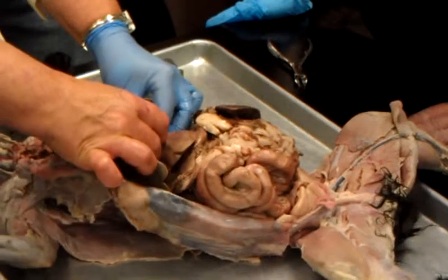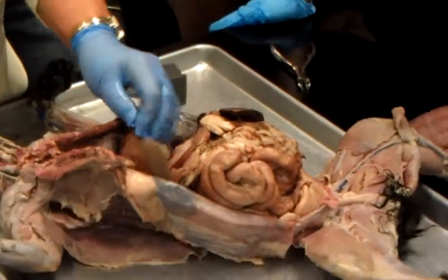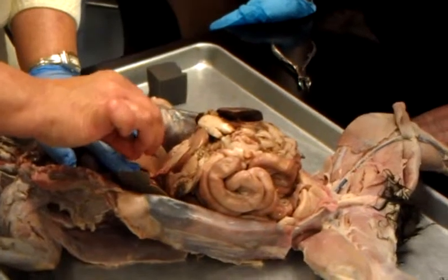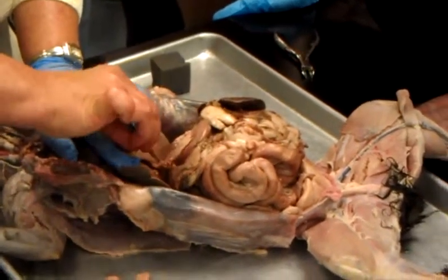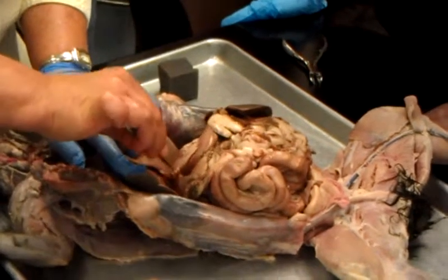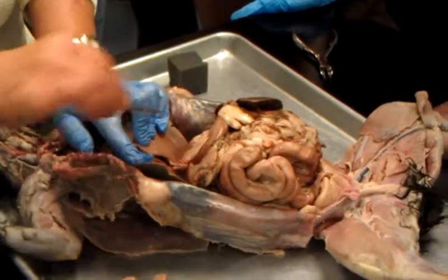Left medial. Small. Left what? Lateral. And then there's a caudate. You have to very carefully make a small hole in the lesser omentum. Don't get rid of it. Make a little opening in it. And see that little piece down there? That's the caudate lobe. Down there.